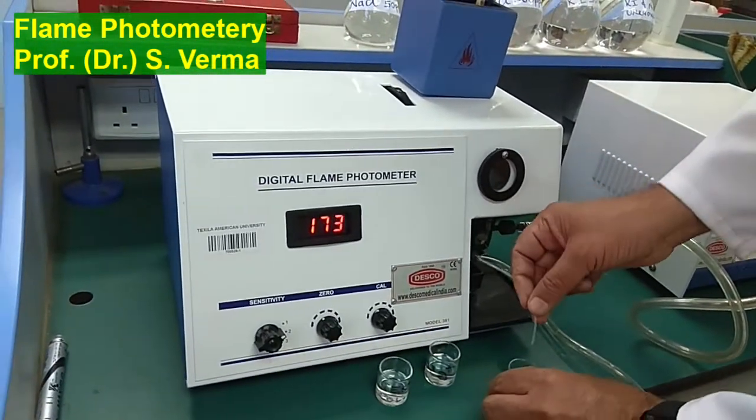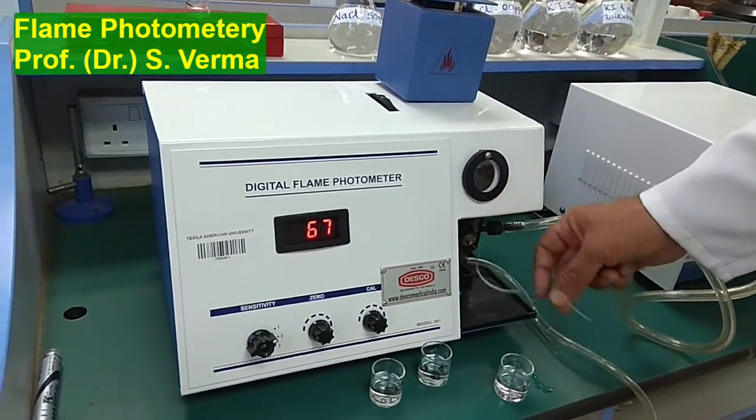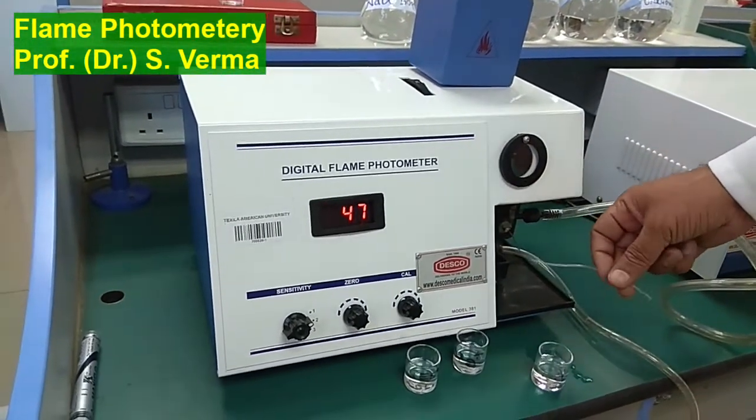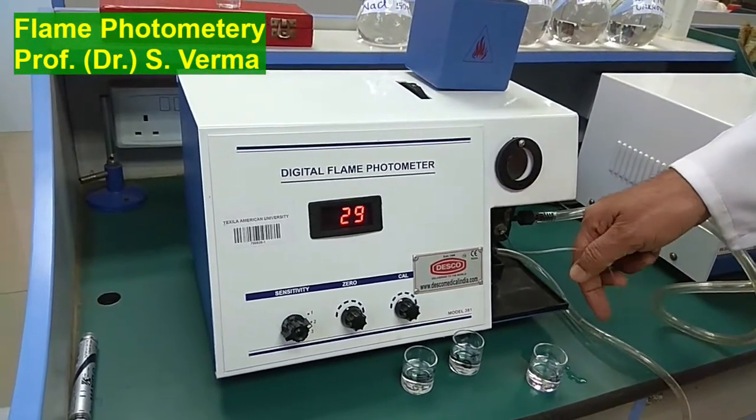So I'll take distilled water and dip this capillary in distilled water, but I'm waiting for some time so that the tube is clean before I dip it in distilled water.